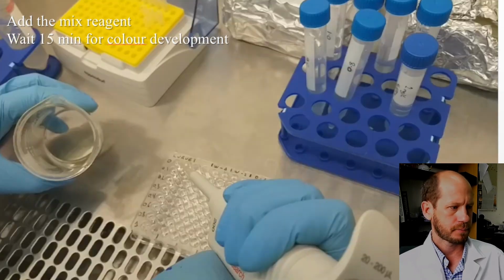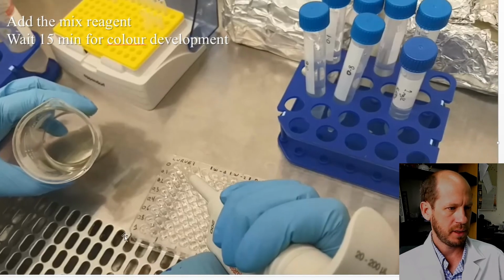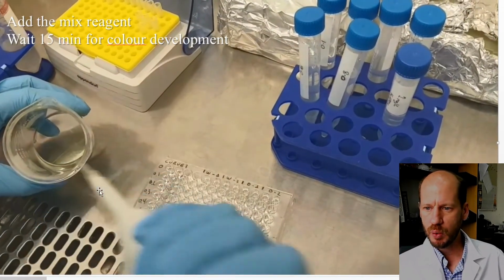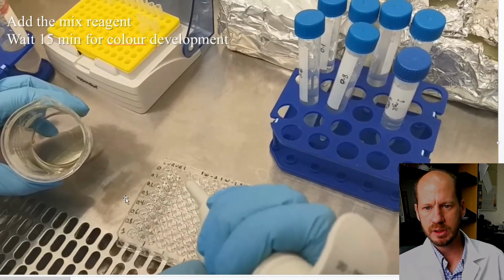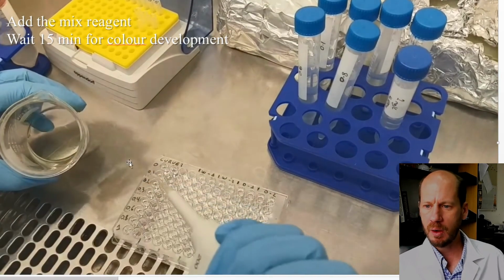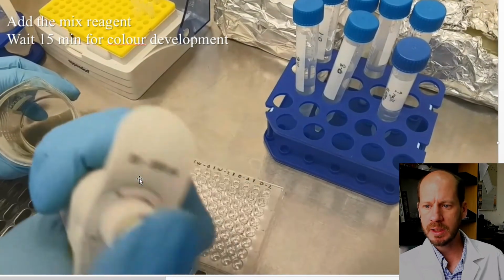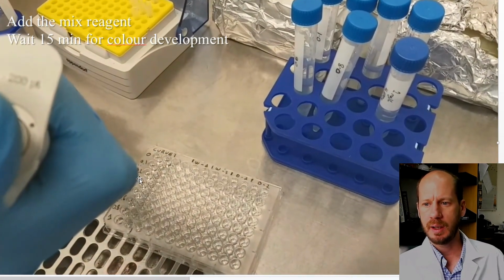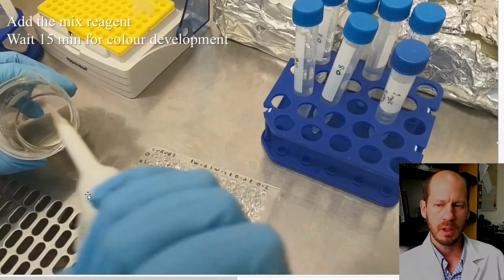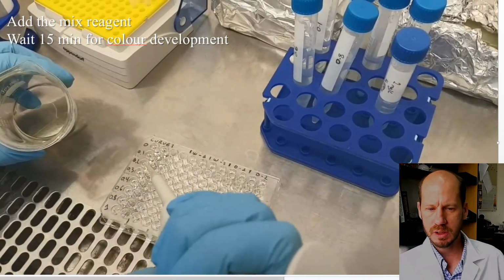After we have this pipetting of the samples, we add 40 microliters of the mixed reagent to each one of these wells of the microplate, and also to our samples, which in our case now will be the diluted extract from the ashes of the plant material. And then we have to multiply back by these dilutions in order to get the concentrations that we have.